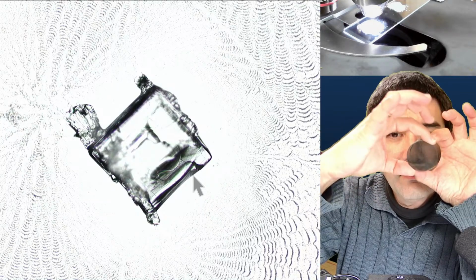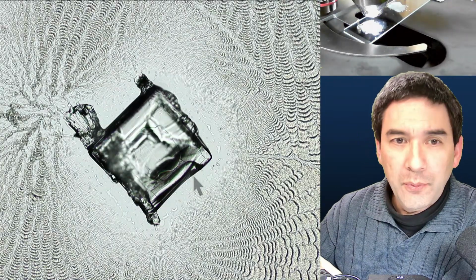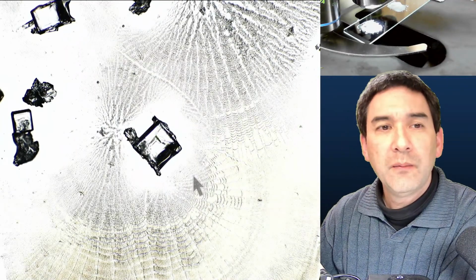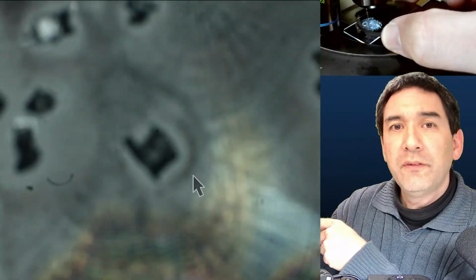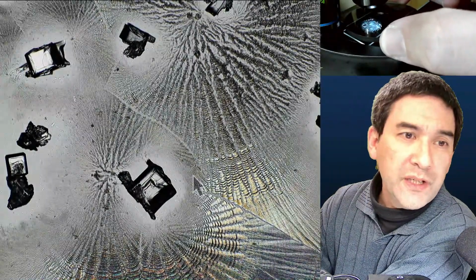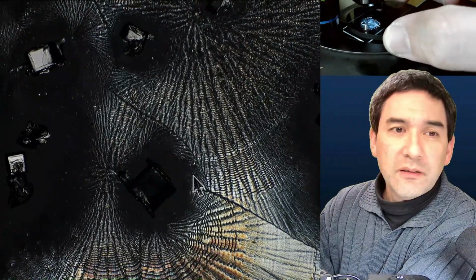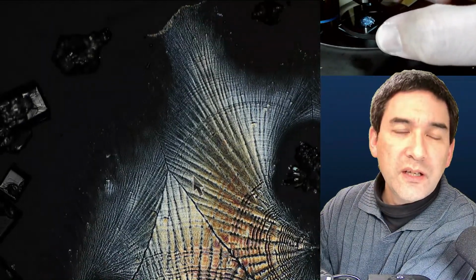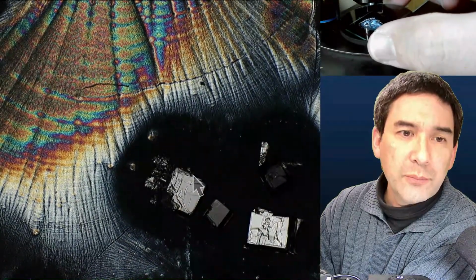What you can do is place one of these filters over the lamp, which you cannot see right now, and the other one, I'm going to use the low power now, you place at the top, between the objective and the specimen. You might have to refocus. Okay, and then I'm rotating the lower one, and you can make it darker. Some of these, you can observe the different colors. Looks quite pretty.